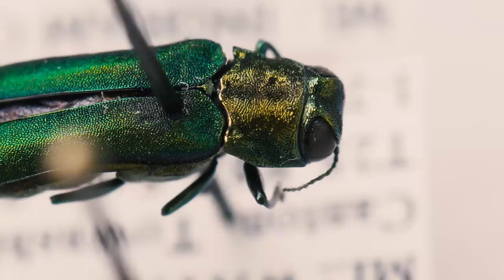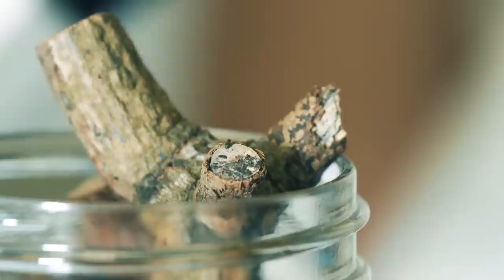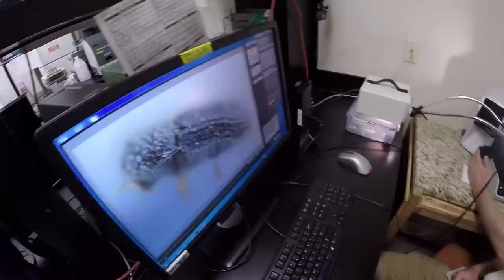Andrew and Yuri here are bark beetle experts. Before we got to our insect, we wanted to get a feel for the size of what they deal with day to day. What's the first step? You can't take a picture of a live one. Yeah, unfortunately these things, they're so tiny and you need to take these composite images, which are stacked with lots of different images.